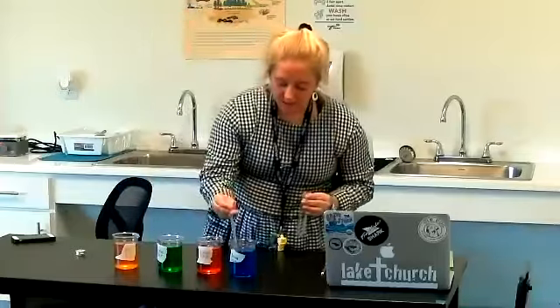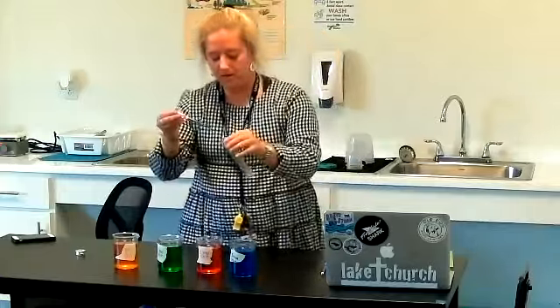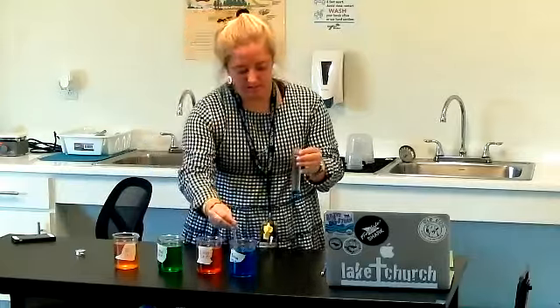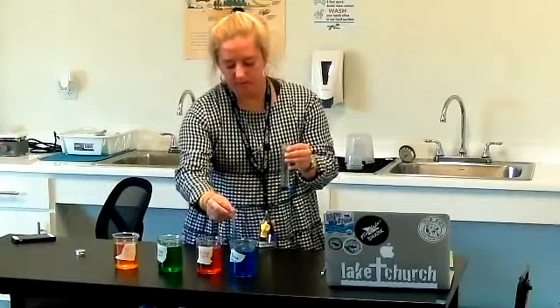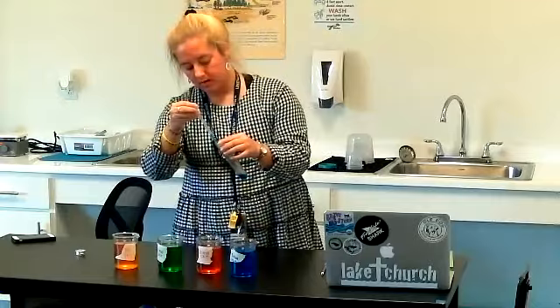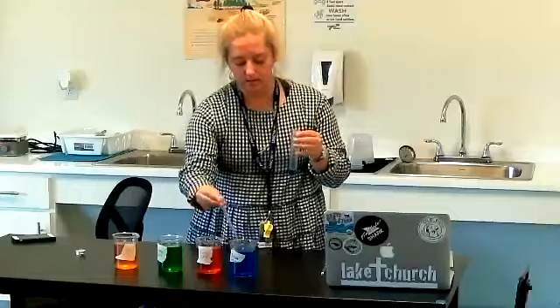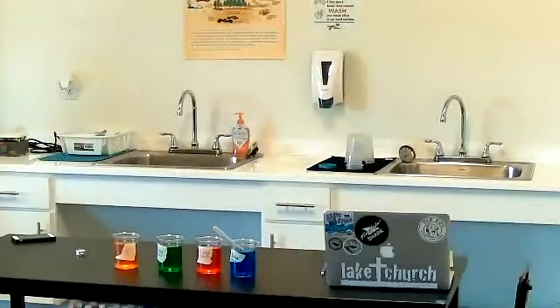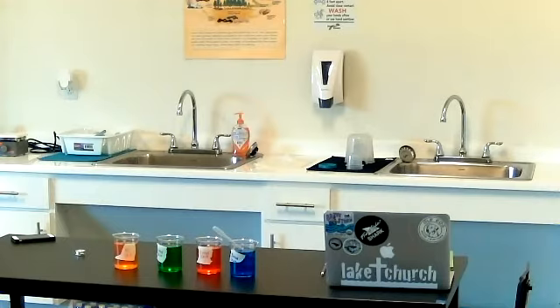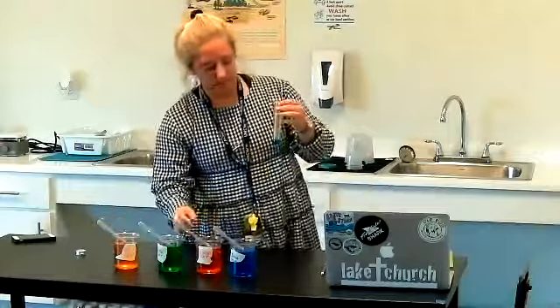So here we go. First I'm going to take my most salt-concentrated liquid and pipette it into my test tube. I'm going to do a little bit more than you would normally do. So if you were doing this in a cup, you would be putting a lot more liquid in than I am. You're going to want to be able to see the different colors. I have now added my blue, or high salt concentration liquid, into my test tube.